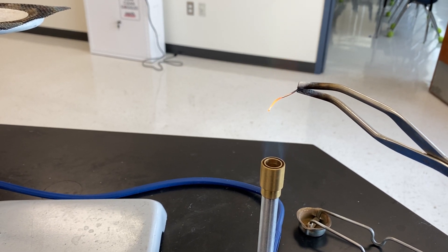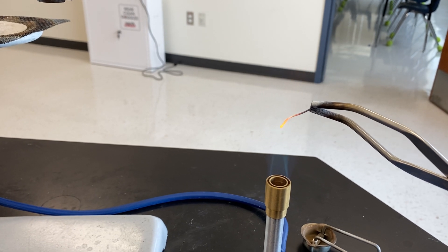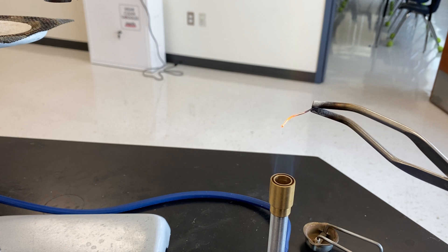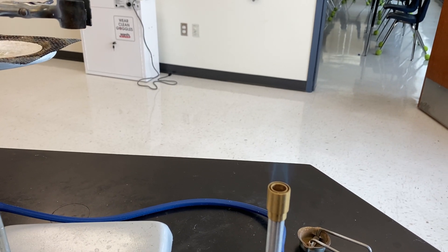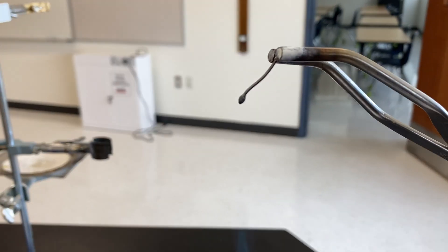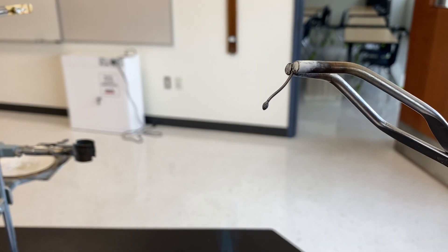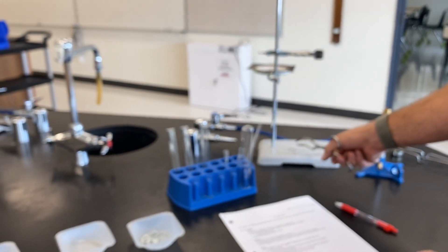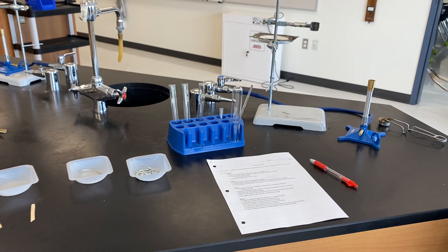We'll leave it there for approximately 90 seconds. We're getting a little flame test — there's a green flame. I hope you can see that green flame. Oh, it's dripping down the burner — we're going to stop there. You'll notice it's changed pretty significantly. I'm going to set this aside so it doesn't hurt anybody. And that was part one. Make sure that you're recording observations before and after the reaction.